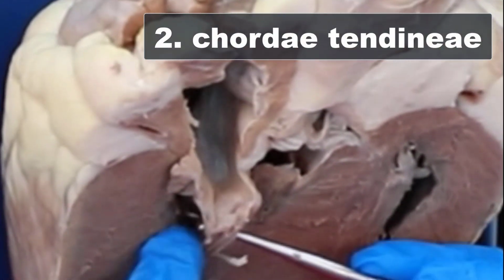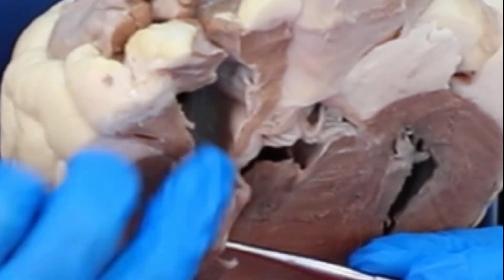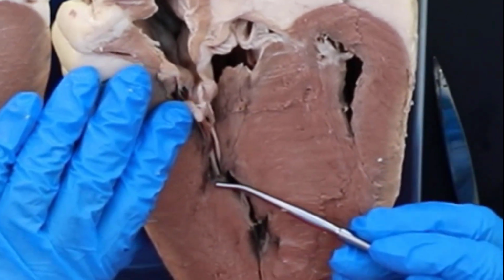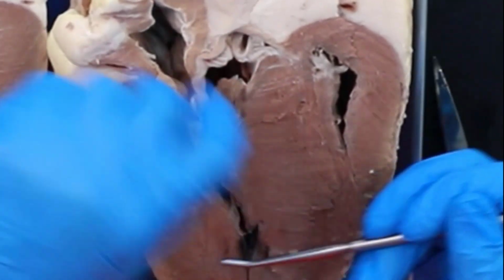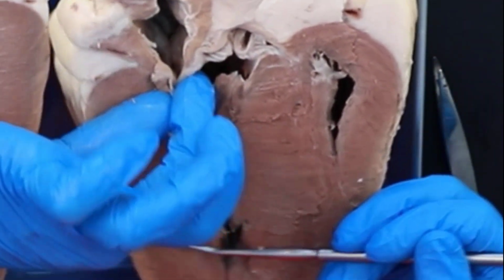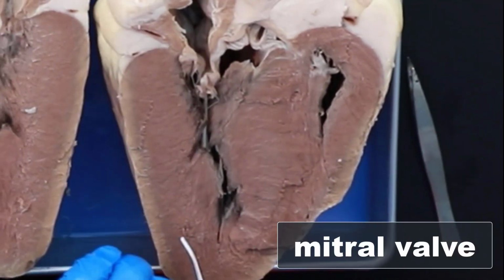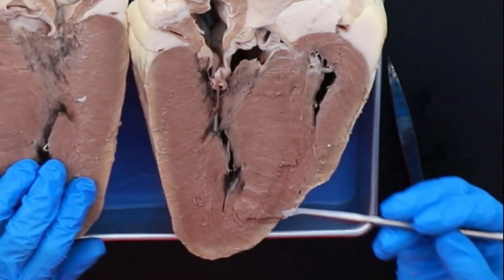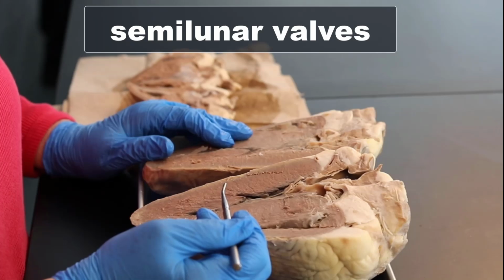chordae tendineae, the tendons that are going to open and close that valve. And then they are attached to a muscle right here, which is the papillary muscle, that contracts and pulls these, and that closes that valve. Okay? So, mitral valve, tricuspid valve. All right?